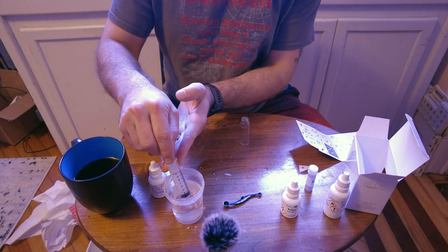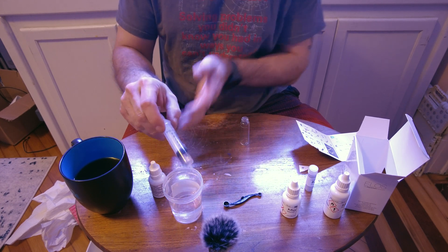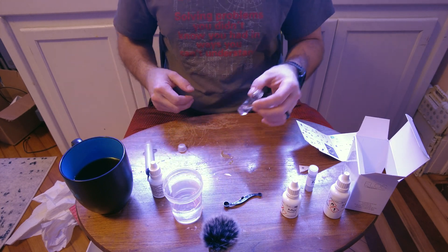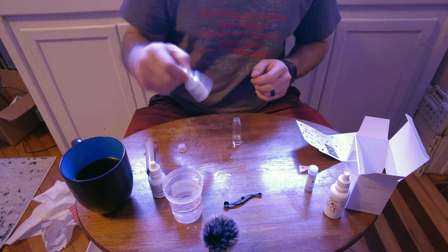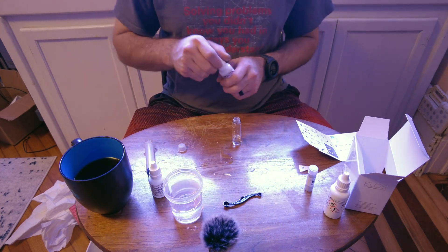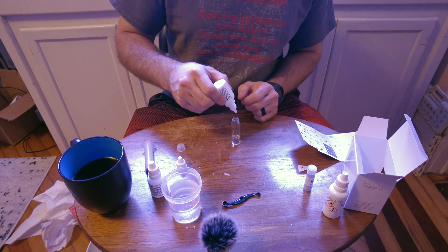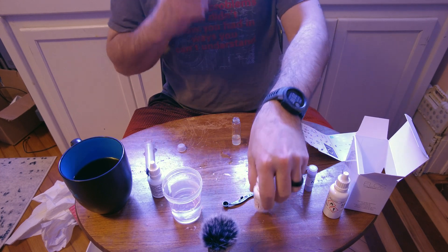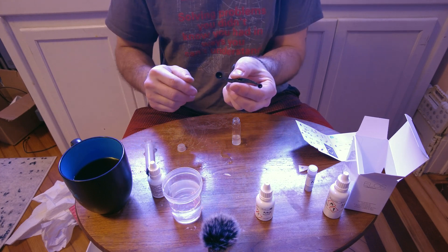We're going to draw up our three milliliters for the second step. These Hanna vials I know for a fact are thicker — I'm sure we've all dropped a few of those. Now we need Reagent B — putting in five drops: one, two, three, four, five.